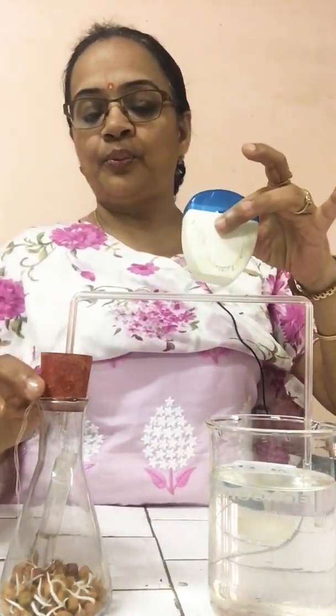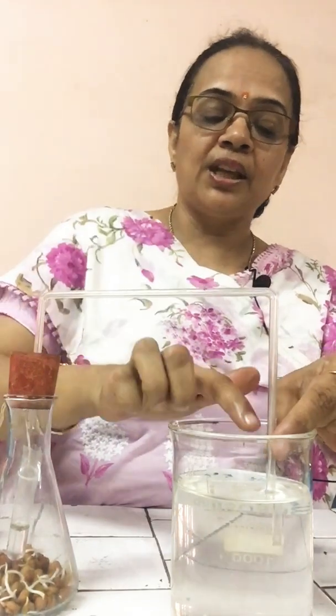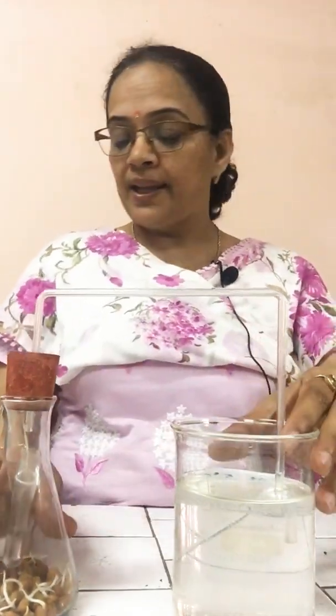Connect a tube through a hole to a beaker containing water. Make all the connections airtight with the help of Vaseline. Here some portion is open, here put Vaseline so that all the connections are airtight. And keep the whole apparatus as such for 1 to 2 hours. What will we observe after some time? After 1 or 2 hours, we will observe that water will rise in this bent tube.